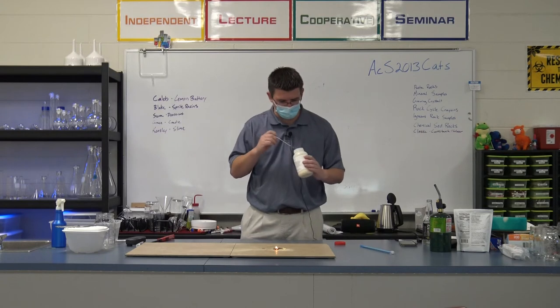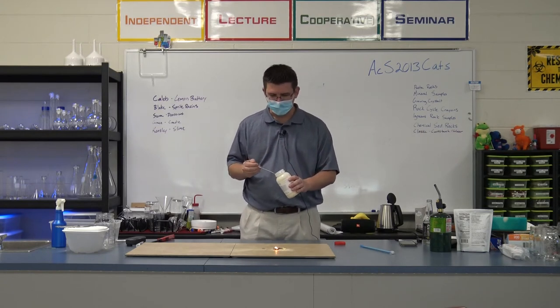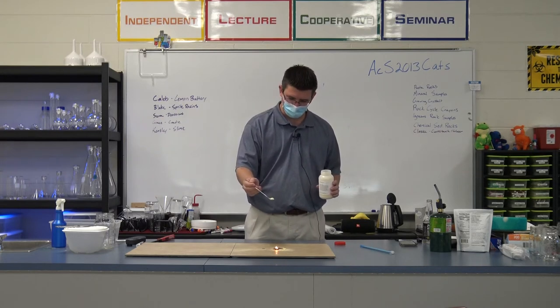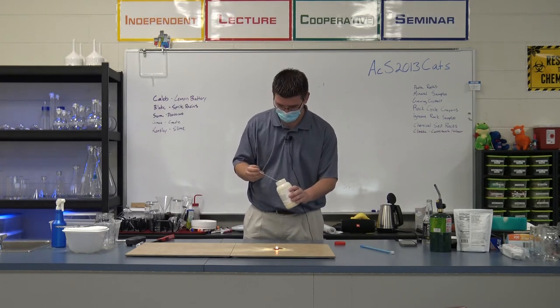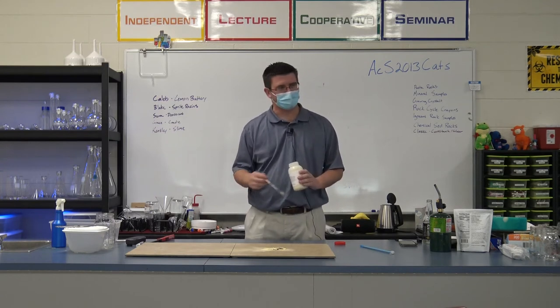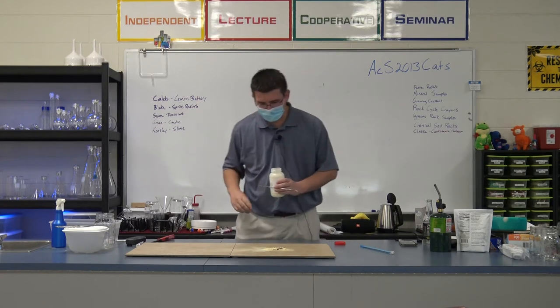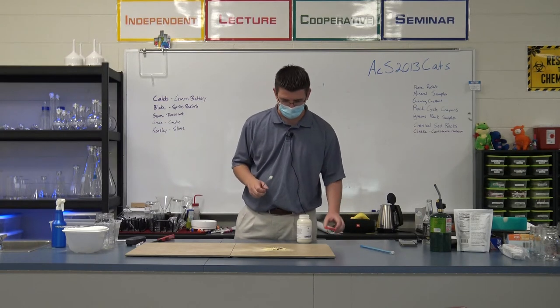All right. So Grace made the observation: I added that very, very slowly. I'm going to add it quickly. Let's see what happens. I'm just going to dump it on. Are you ready? 3, 2, 1. Dump. Oh, I missed. Hang on. Let's try this again. Let me get it a little closer. 3, 2, 1, dump. Well, it still kind of did it, but it did go out a lot quicker, right? It was just kind of a shoop. So it did burn out quicker, but it still did something similar.